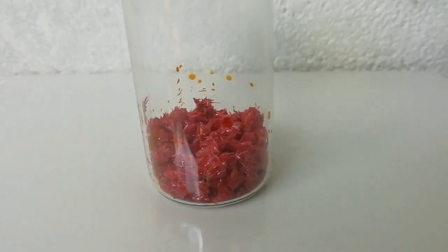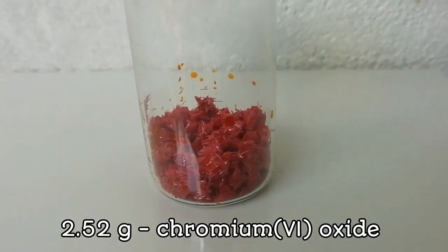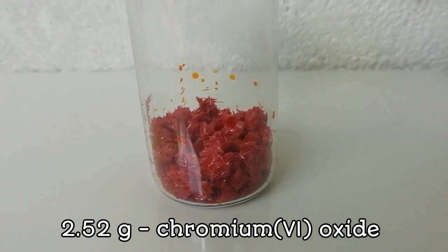Here is the final result: 2.52 grams of chromic anhydride.